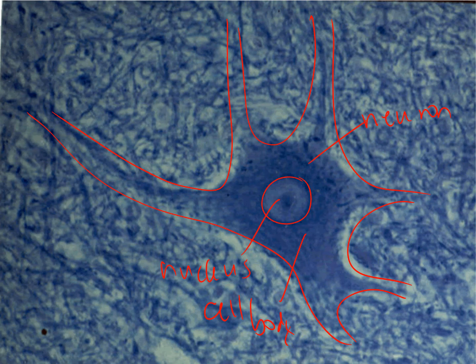Now, all the other stuff you see in the background here, this is nerve support cells called neuroglia. Literally translated, this means nerve glue. So these cells may insulate the neuron cell, they may increase the transmission of a nerve impulse, or they may simply be there to help provide protection from, say, viruses or bacteria. So neuroglia and neurons together make up nervous tissue.